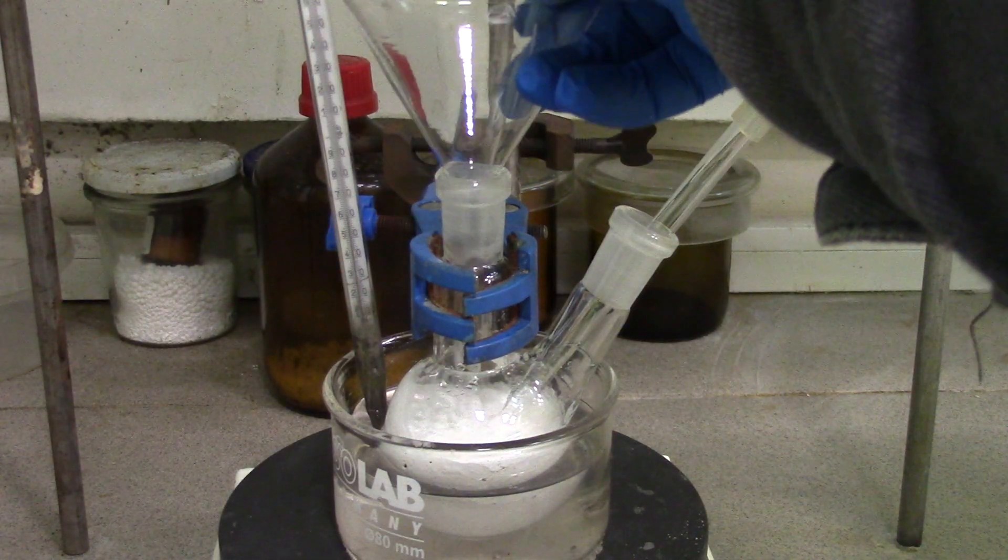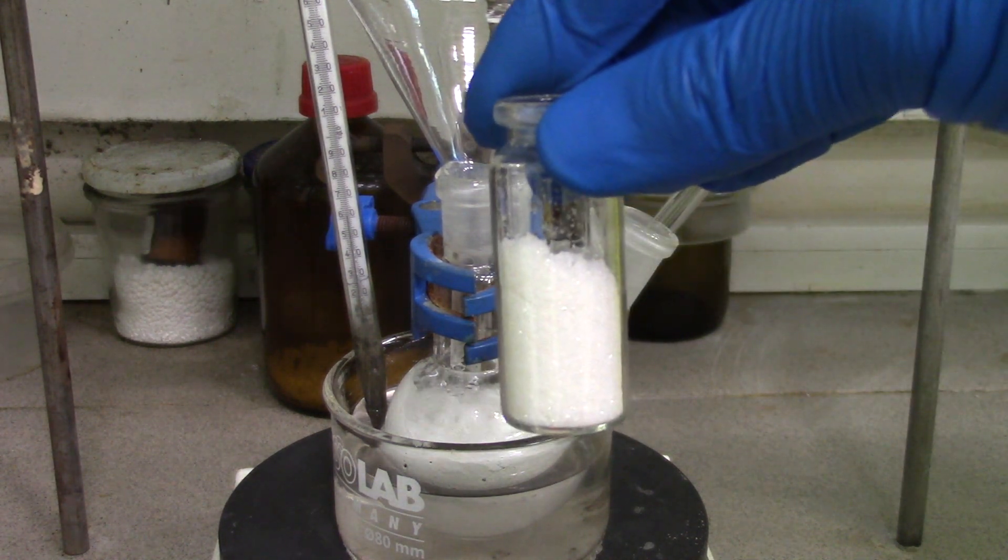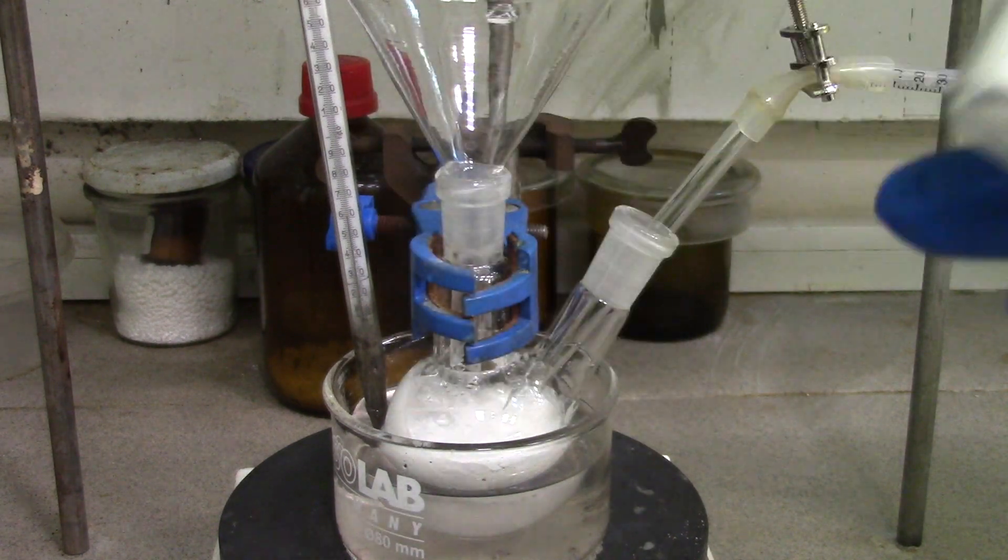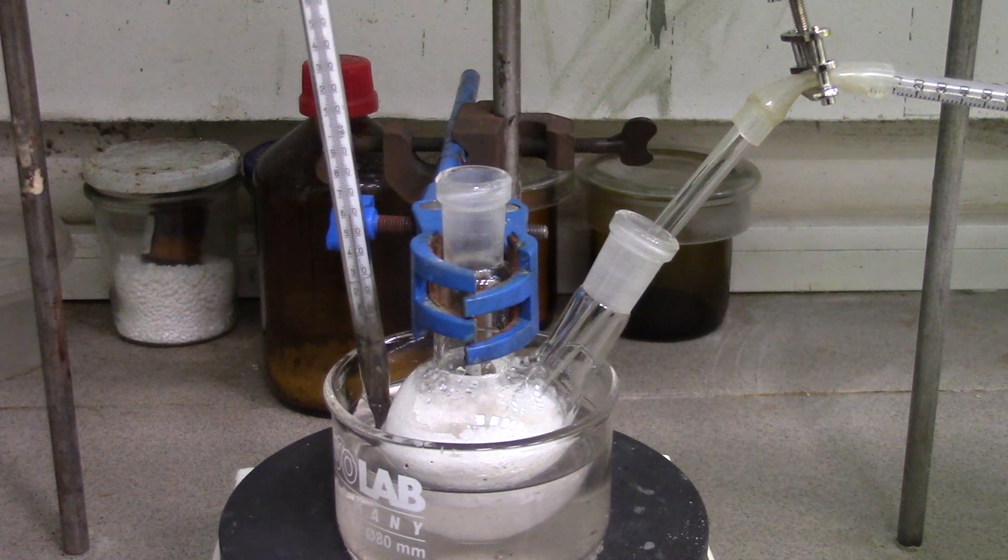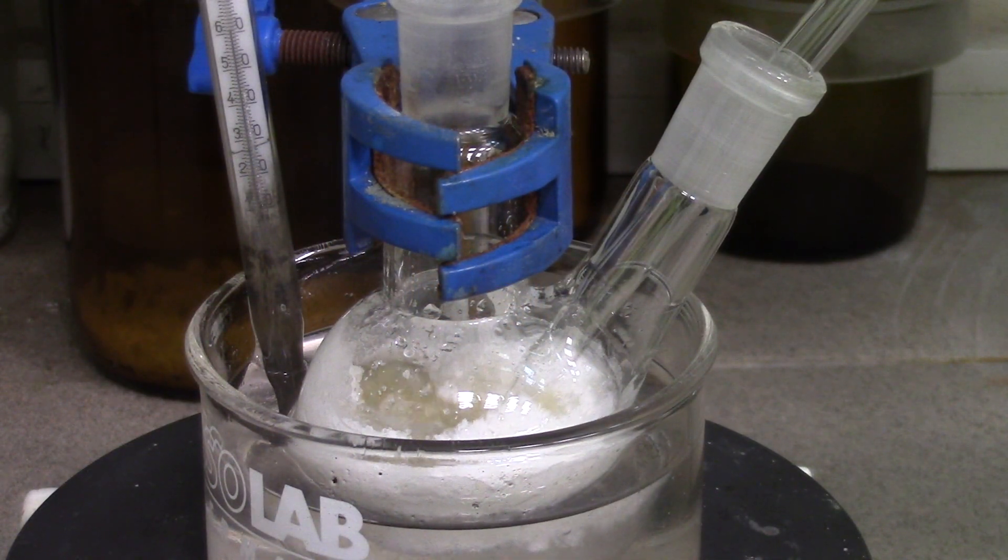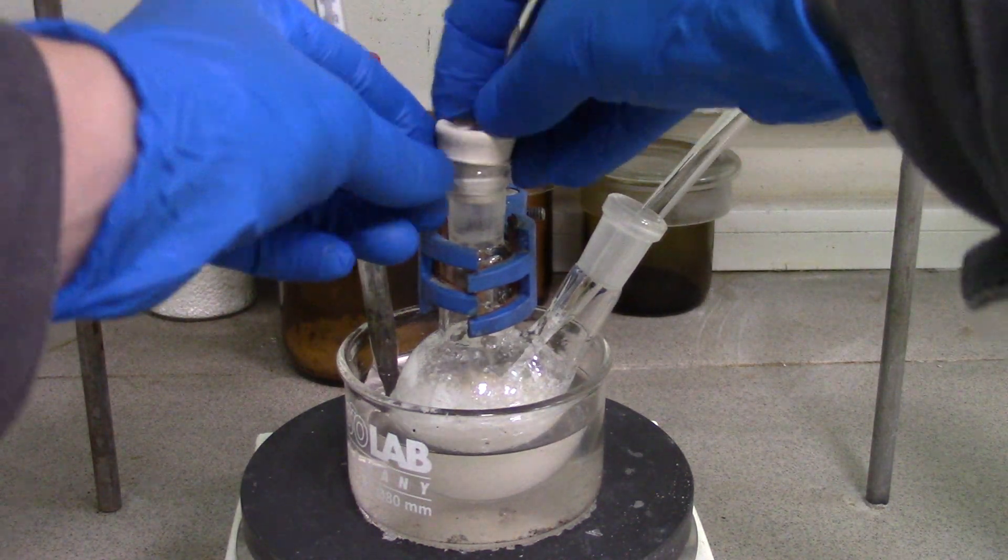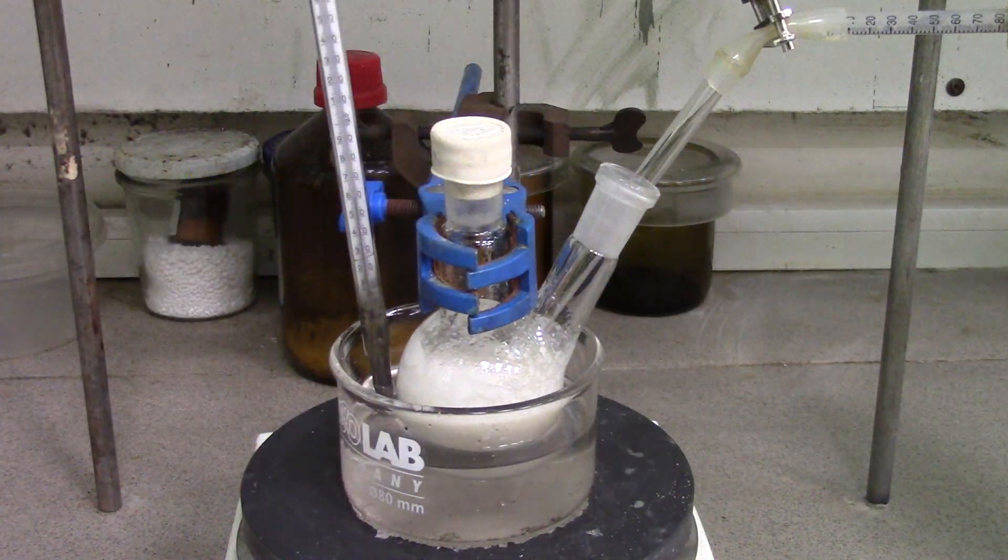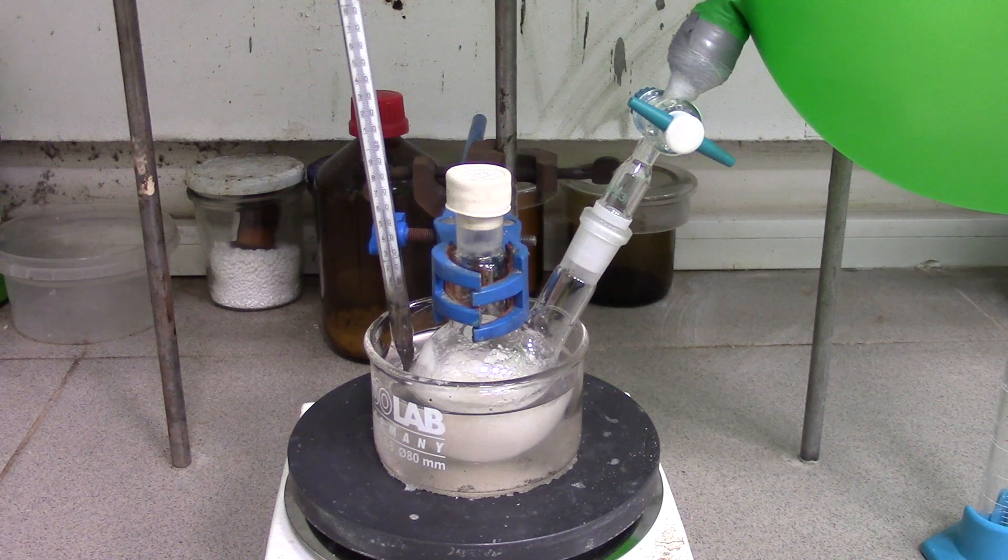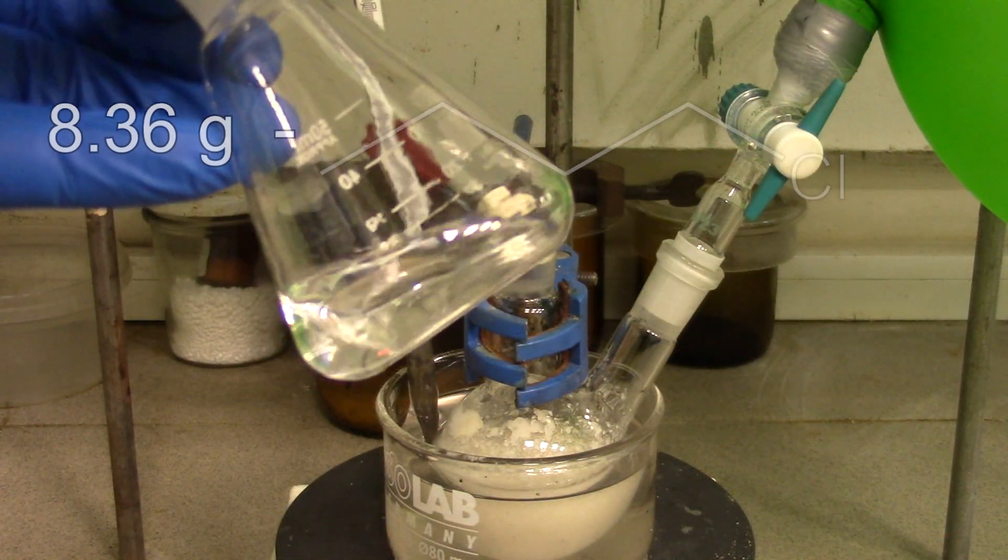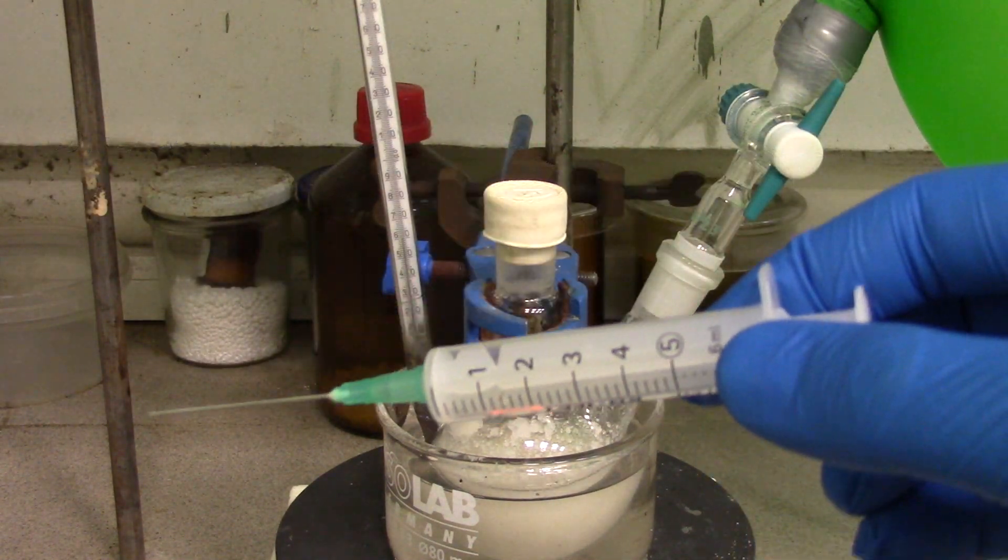After time is gone, I have added 3.437 grams of tetrabutylammonium bromide as phase transfer catalyst. Then I have just closed one neck with a rubber septum and changed a balloon with pipette to another tap. At last, 8.36 grams of butyl chloride is added through the septum with a simple syringe.